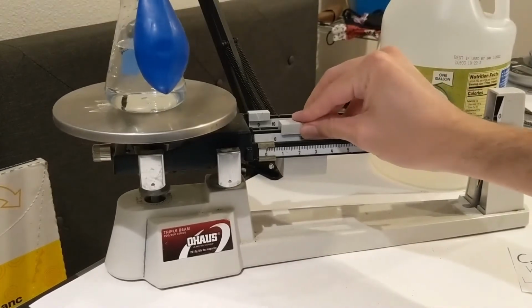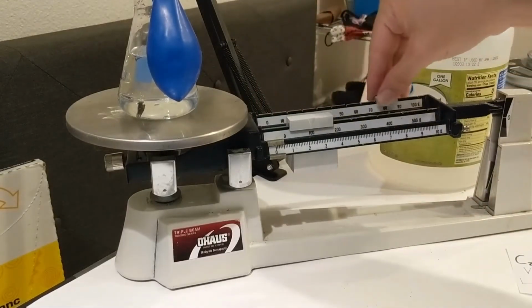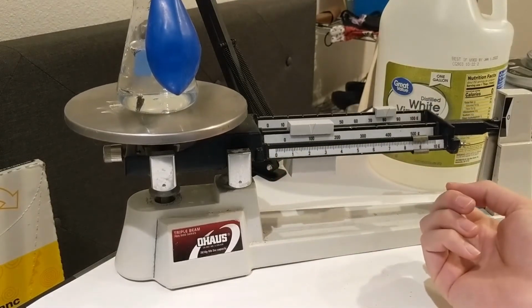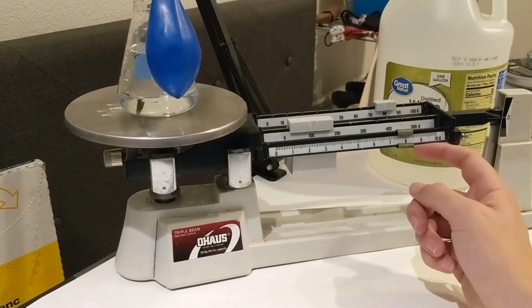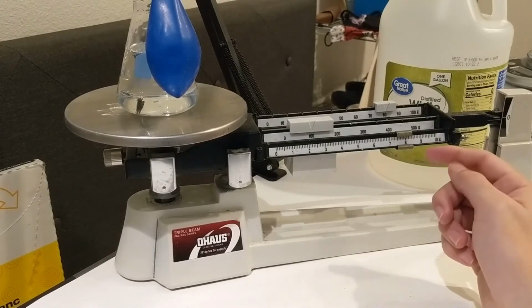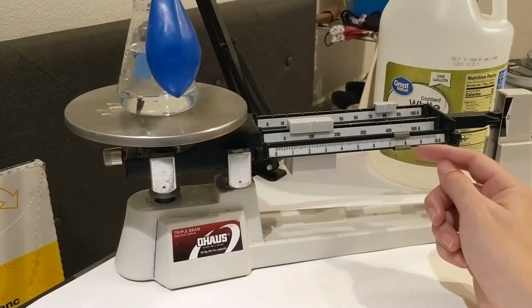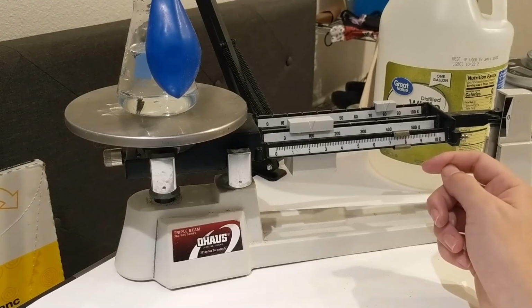Looks like it's not quite 200, so 180 something. Let's take a look. I'm going to say 187.